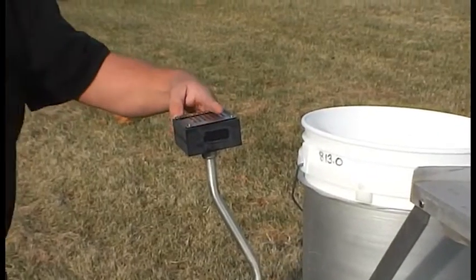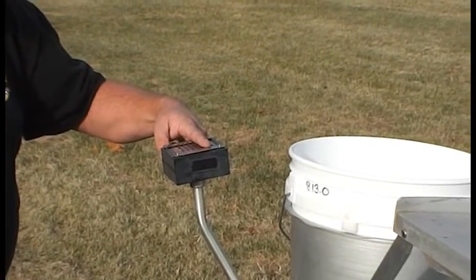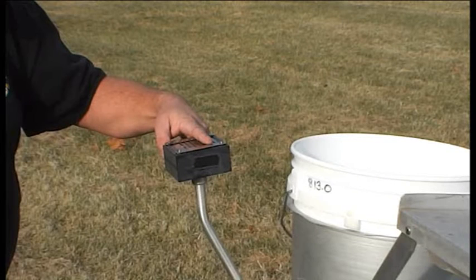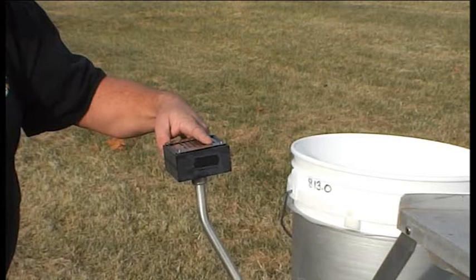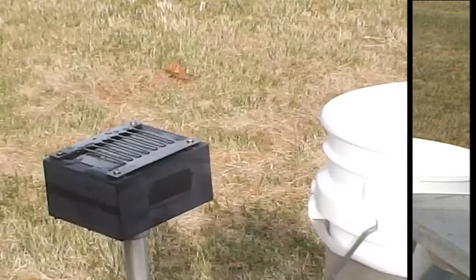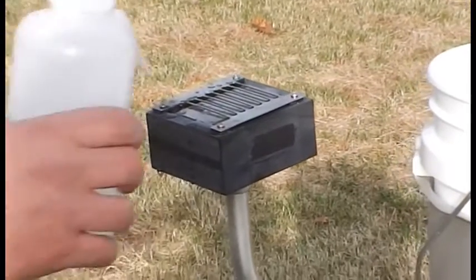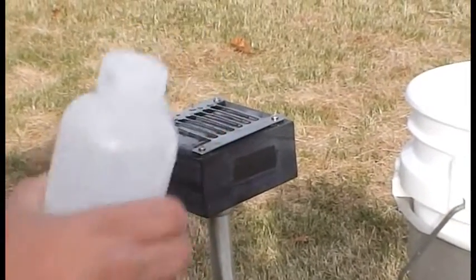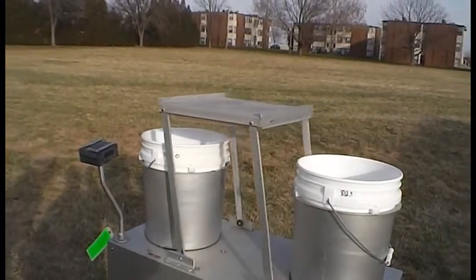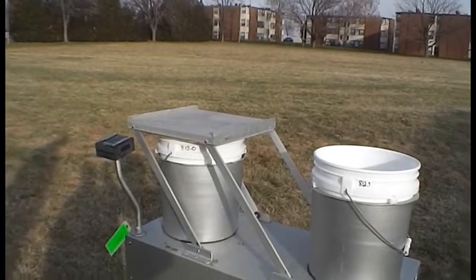We now need to verify that the sensor is operating properly and heating. Place your finger along the sensor grid, as shown here. If the ambient temperature is less than 40 degrees Fahrenheit (4 degrees Celsius), the grid should be heating and feel warm to the touch. Once you have checked the sensor, you can activate the collector by placing several drops of water or a small amount of snow on the sensor grid. This should activate the collector, allowing it to remain open for several minutes while you complete the sample changeout.